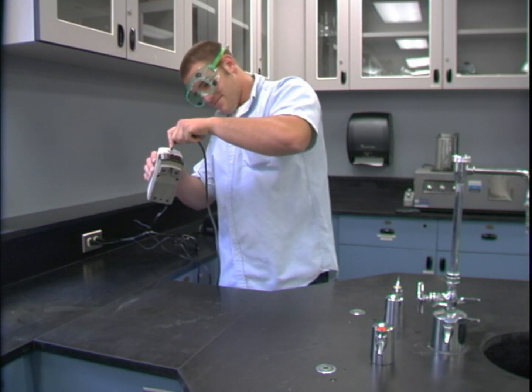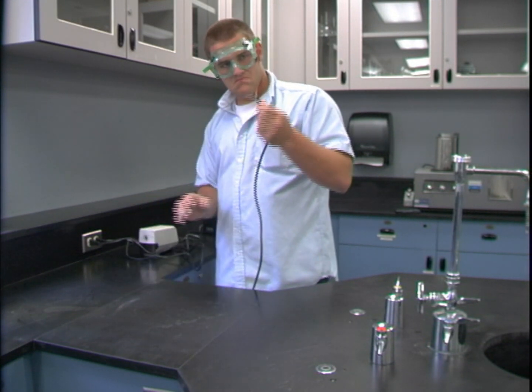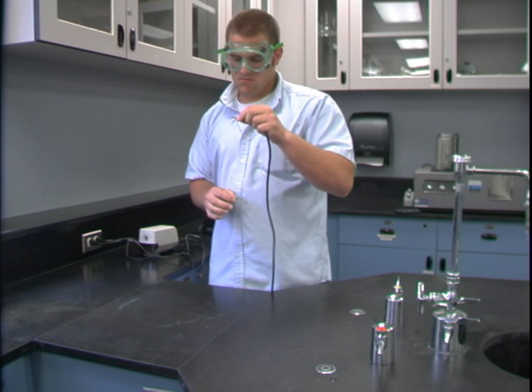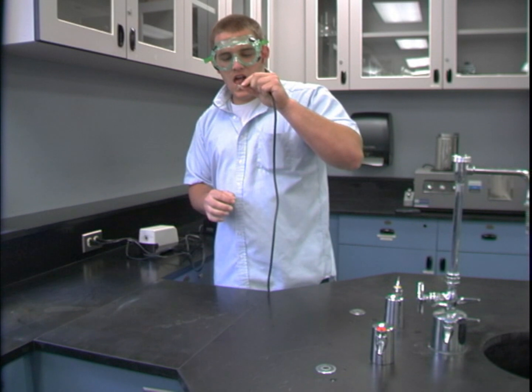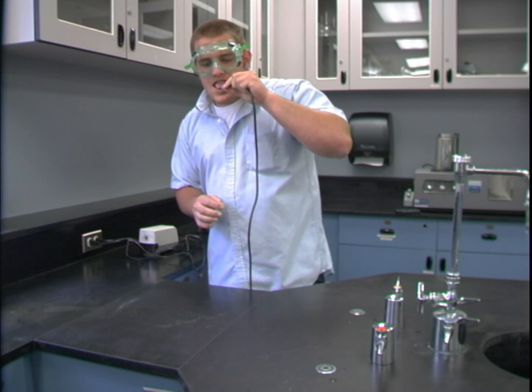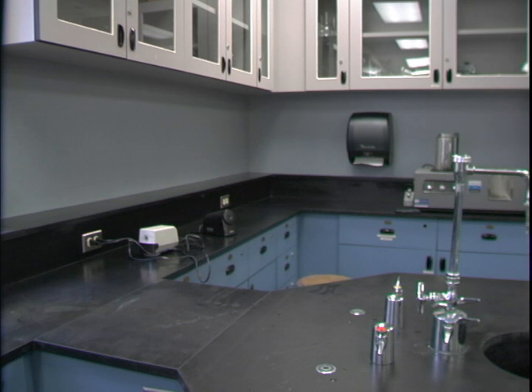Turn off the power switch before plugging into an outlet. Never jerk plugs from the outlet or pull them by their wire. Be familiar with operating instructions before using any electrical equipment. If you do not follow just one of these safety rules, the results could be deadly.